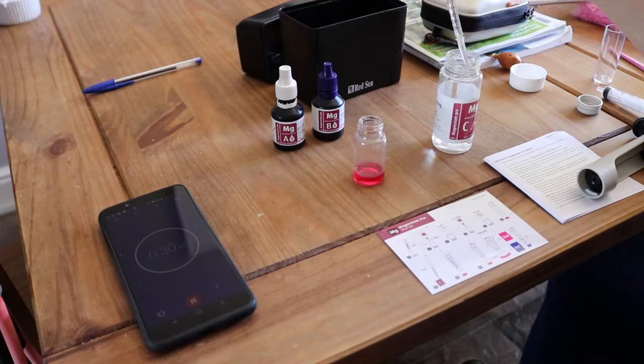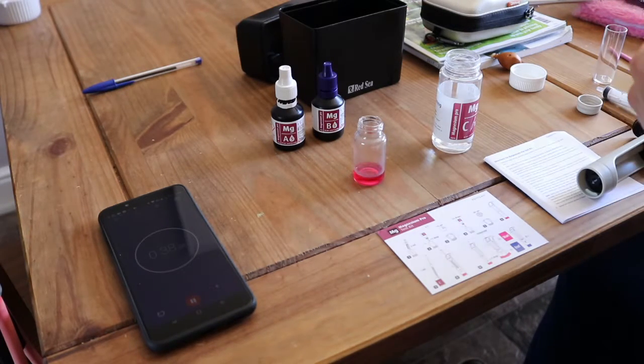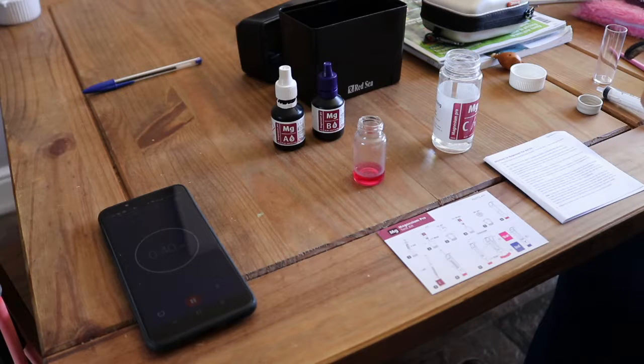So I'm not going to go on about where the plunger should be, because everyone knows the answer to that. Stick it in. Right, so after doing that, I've still got 15 seconds left.